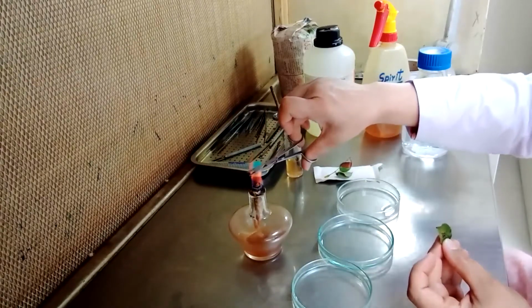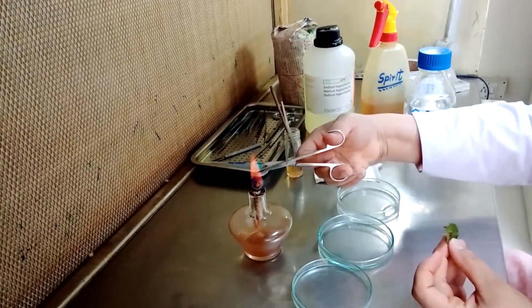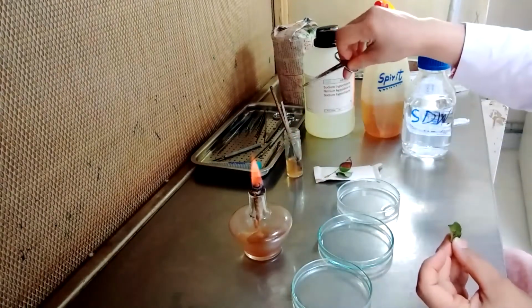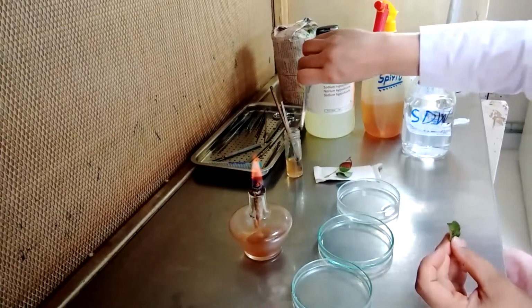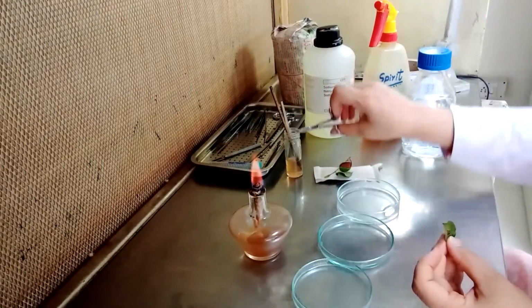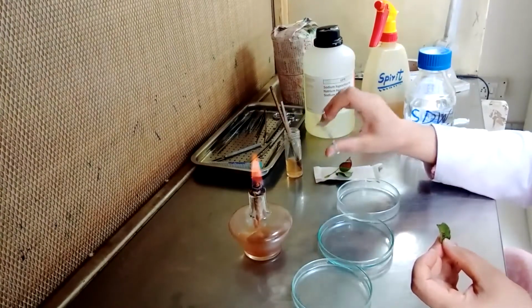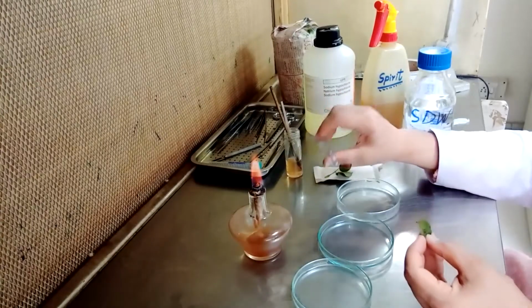We will sterilize the scissors on the flame till it gets red hot. Let it get cool. Give it a dipping in the methylated spirit so that we may speed up the cooling. Let's wait, be patient.